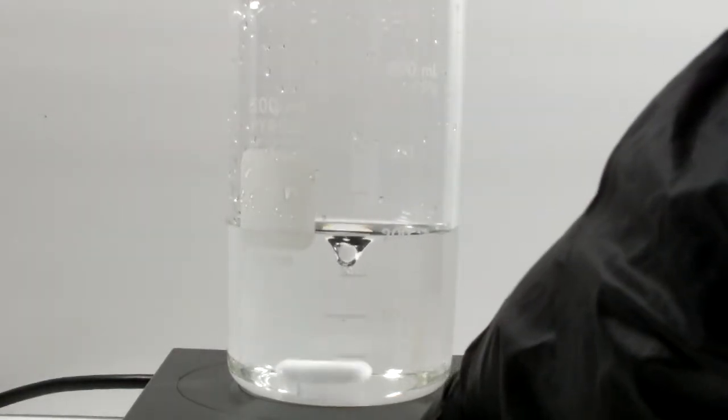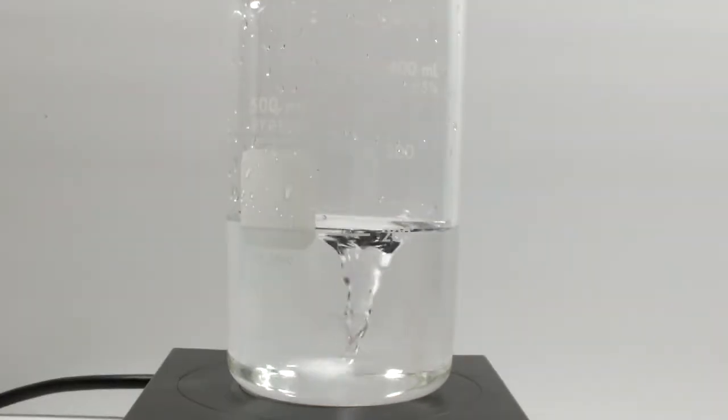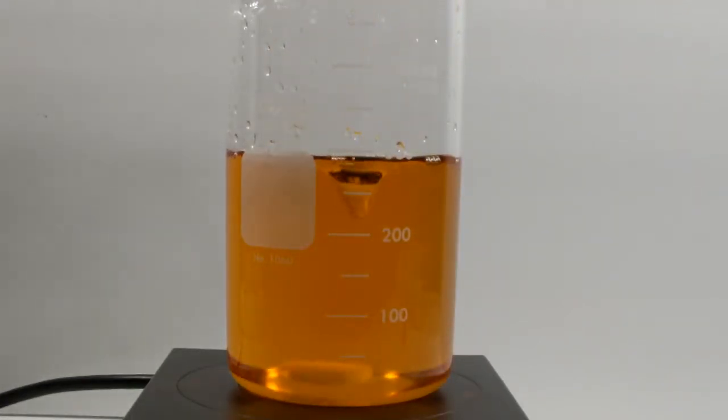As we saw in the first video, it should generate a little bit of bromine and turn an amber color. Clearly, that's not happening. I'm going to keep going anyway and see what happens when the cerium solution and ferroin get into the mix. So next up, 100 milliliters of the cerium ammonium nitrate solution in dilute sulfuric acid. Obviously the solution is colored, but at this stage there is not supposed to be a color change, which is good because there wasn't one.